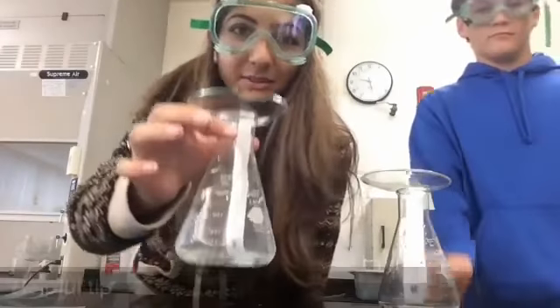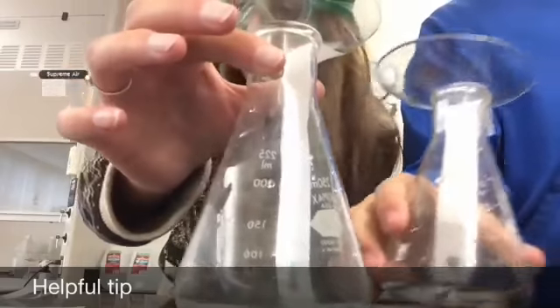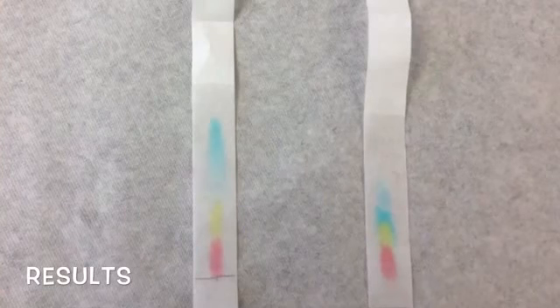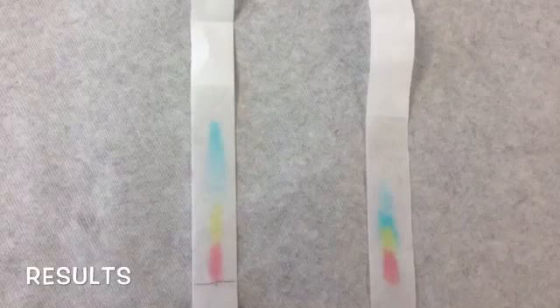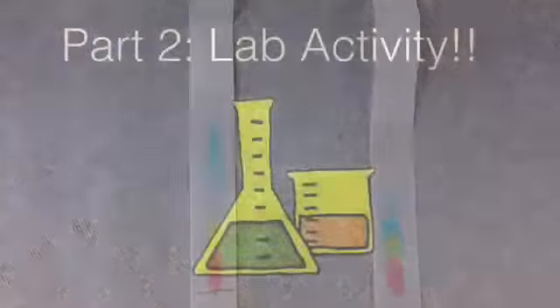So basically notice we're not getting the solvent anywhere above the tip of our dye sample, because if we did, then the samples will dilute into the solvent. As you can see, on one of the chromatography strips, the dye traveled further and separated out more. So now it is up to you to eliminate one and take the other one and test the effects of different concentration on the dye.